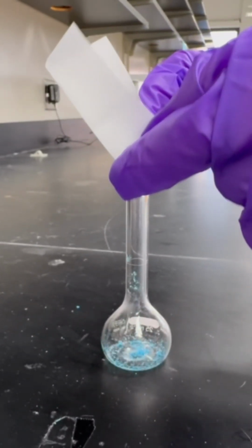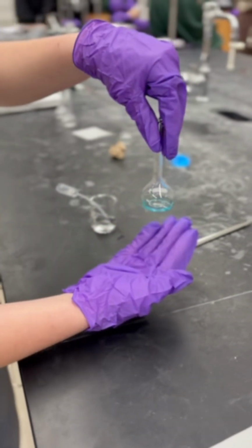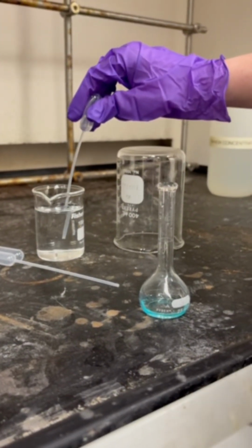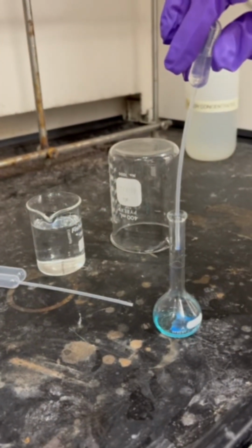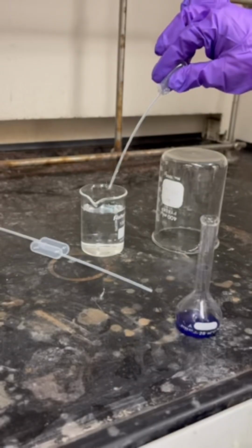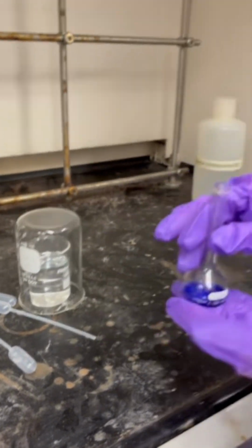We got about 0.087 grams, and we transfer that into a volumetric flask. We then dissolve it with water, and that creates the complex ion of hexaaqua copper. We then add concentrated aqueous ammonia to the dissolved copper, and upon first reaction, it will make copper hydroxide, which is insoluble. But in the presence of more ammonia, it then makes the complex ion copper amine.